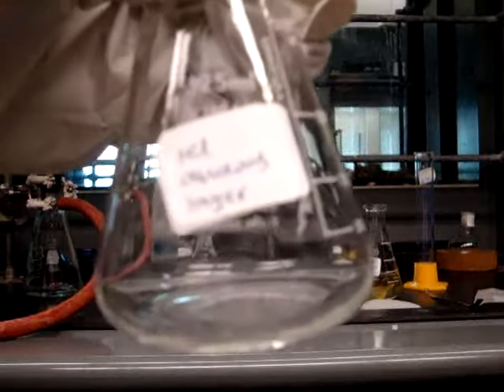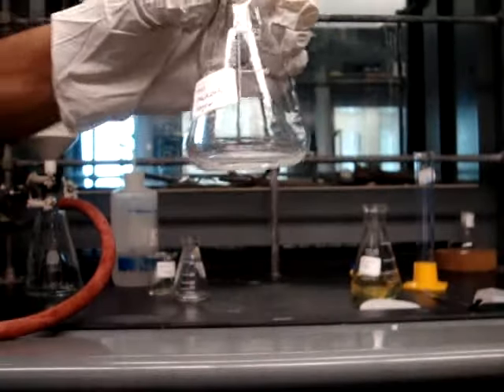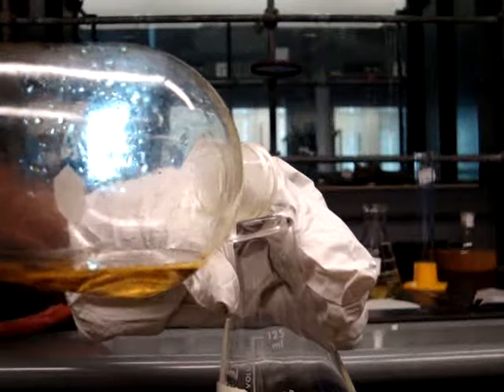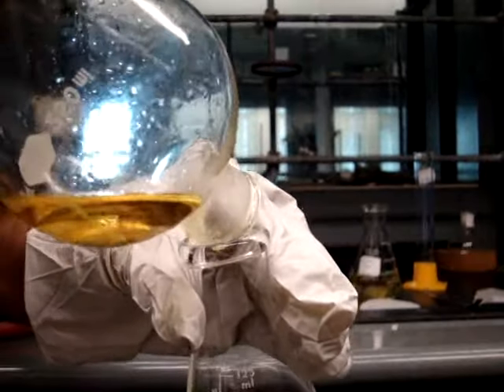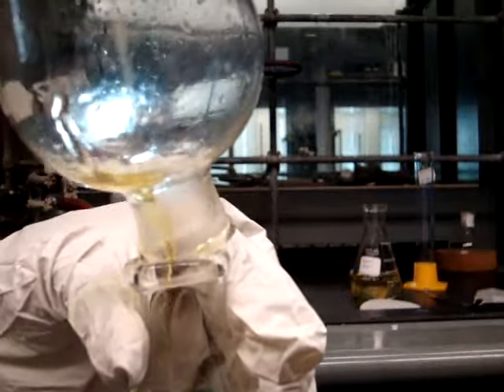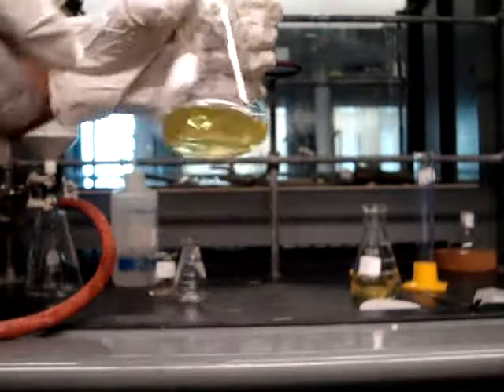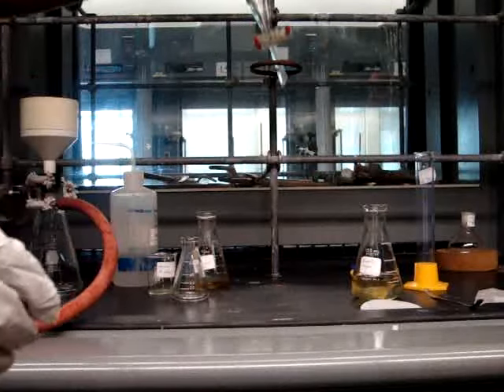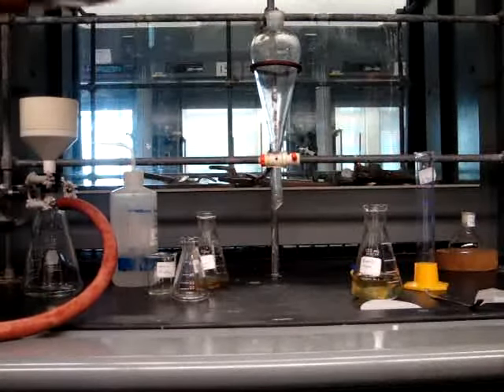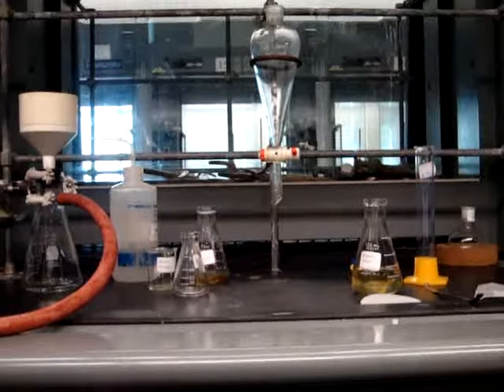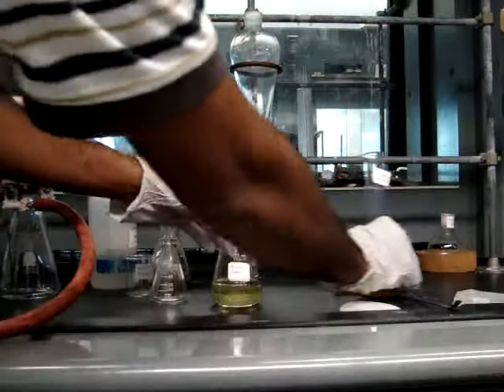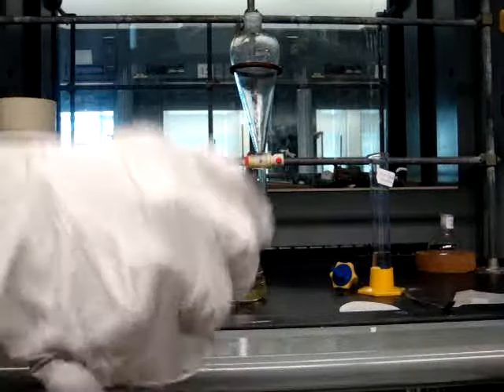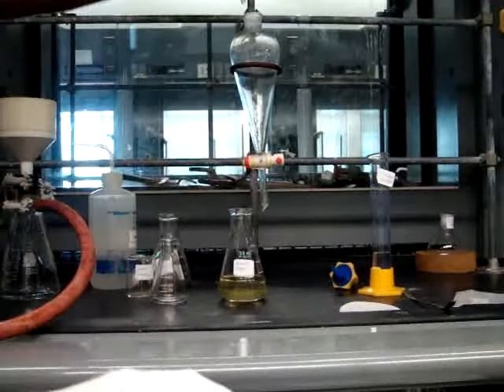Now that you have separated out the organic layer, we're going to be pouring the aqueous layer into a separate and labeled flask. You'll need to do two more extractions with the hydrochloric acid, fifteen more milliliters each time, to make sure that you're extracting out all of the P-nitro-aniline in the organic solvent. You're going to want to pour your remaining organic layer back into the separatory funnel. Use a funnel to make sure that you're not losing any of your solvent.